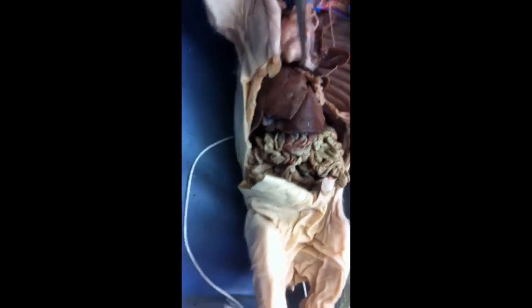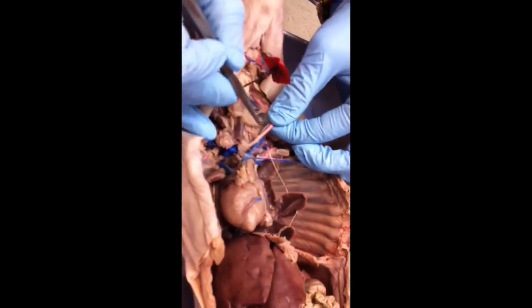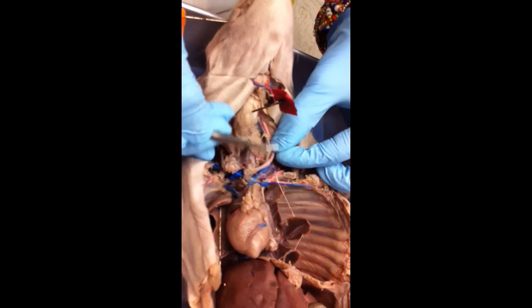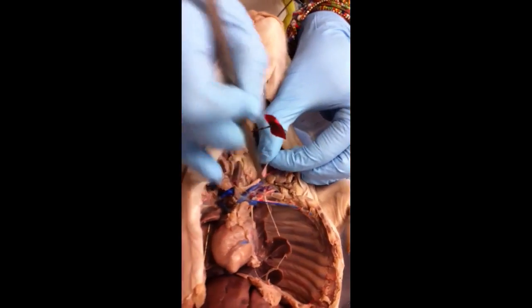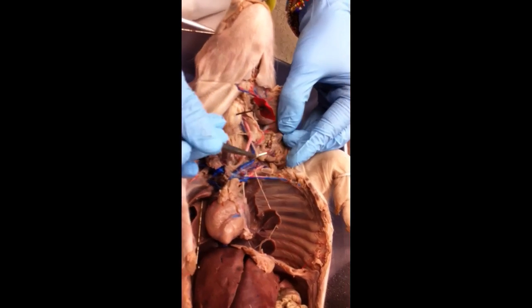Do you have two of each? Yeah, you have them on both sides. Yeah, and then the other place you might see me labeling the vagus nerve, because both vagus and phrenic are starting from up here and going down. But another common place that you'll see vagus nerve marked is here, running along the common carotid artery. Either one would be vagus nerve if you string around that.